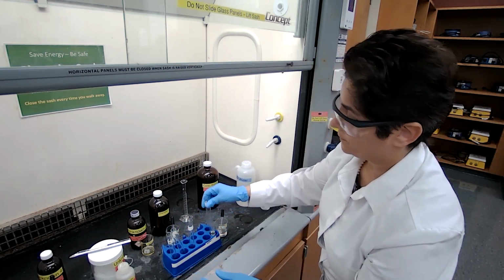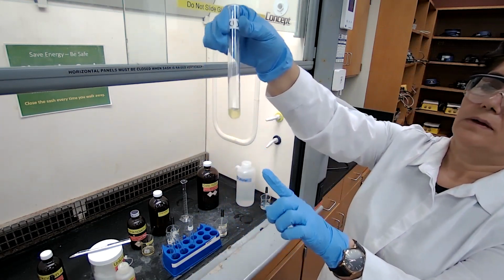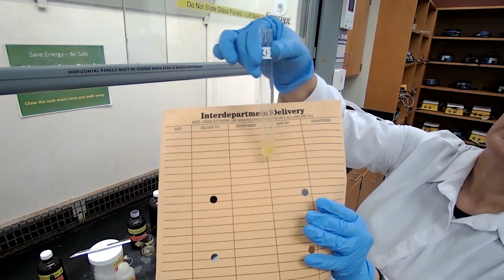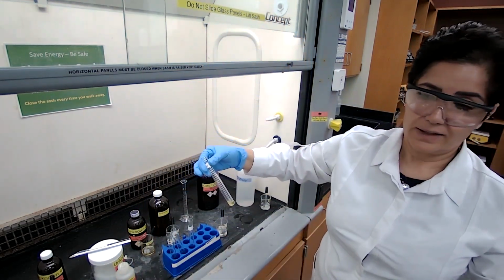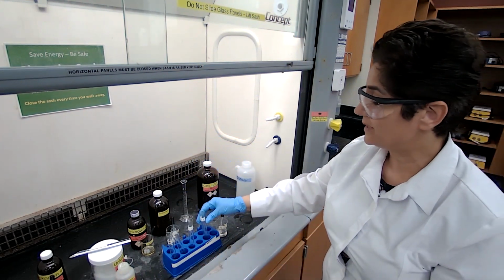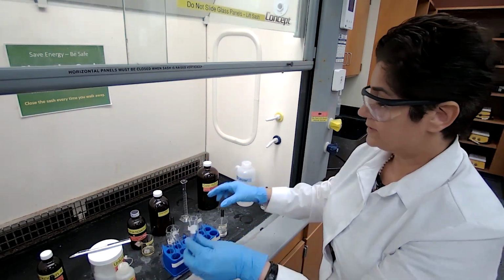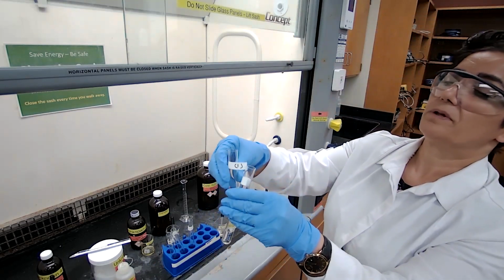Okay. So test tube 1, the color change, where you could see it better. There's a color change. It's not white color. How do I know it's not white color? And what should I do to see that there is a white color? I'm going to get a test tube that has a clear solution, so you could see the color change better, okay? Just using this as an example.